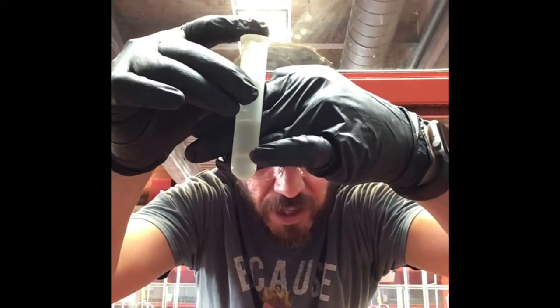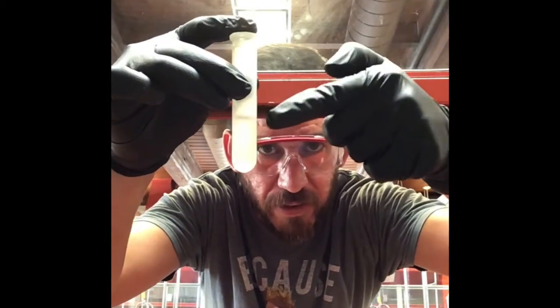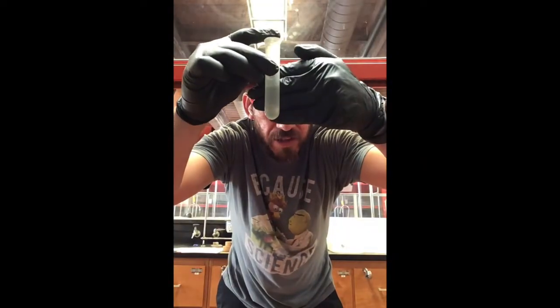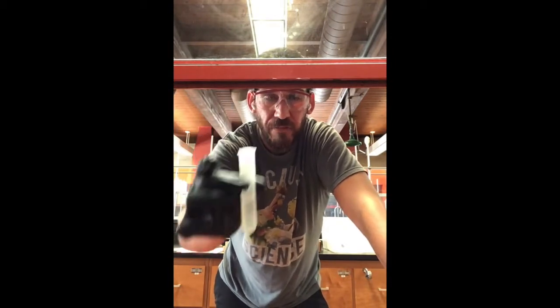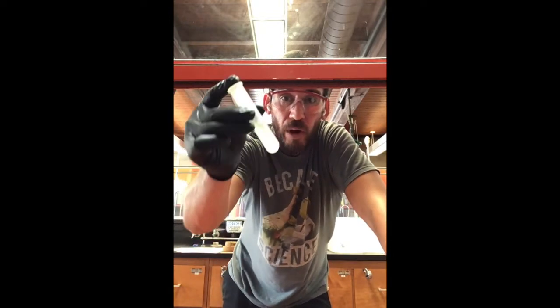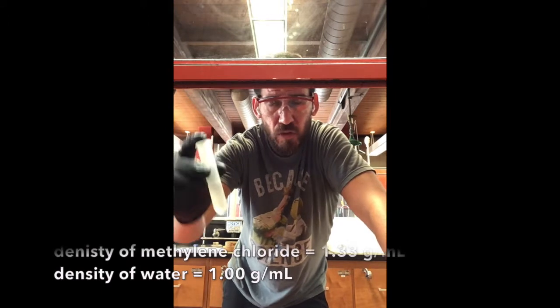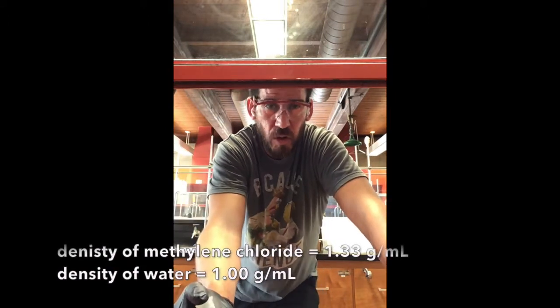So one of them is right there. See that? And then the other is up here. So that's just like oil and water. And so it's really important for you to write down your physical properties in your laboratory notebook so that way you know where methylene chloride should be and where water should be. Methylene chloride is really dense, much more dense than water.